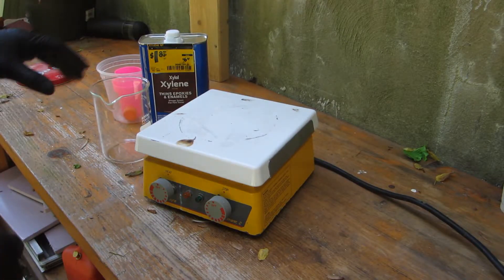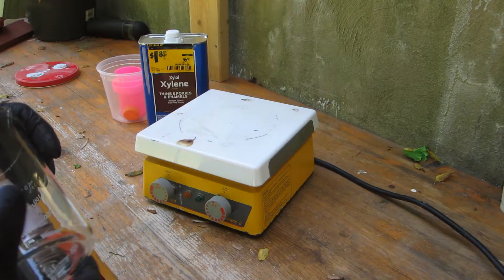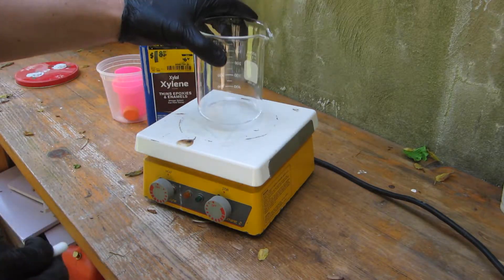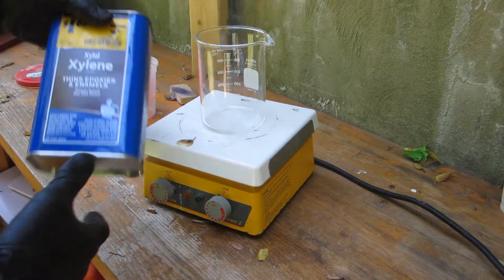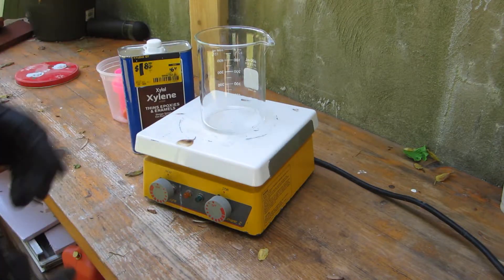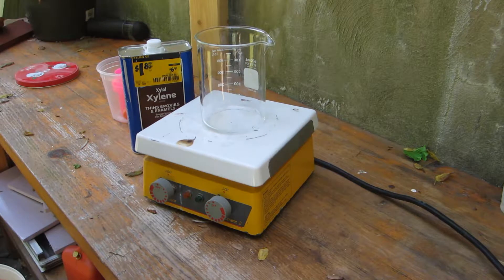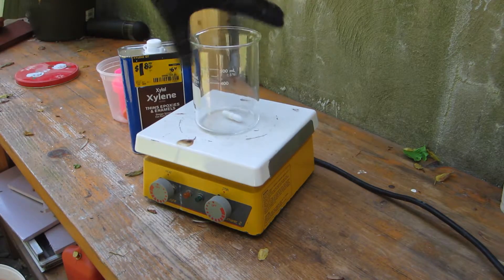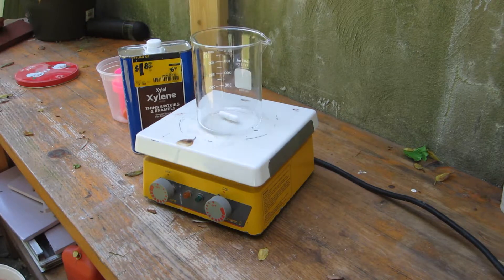It's a lovely day today and I'm back here in nature's fume hood, some people call it the outdoors. I've got my best friend discount xylene here and I'm going to try and dissolve some plastic. I got tired of breaking peanut butter jars so I invested in a Pyrex beaker.